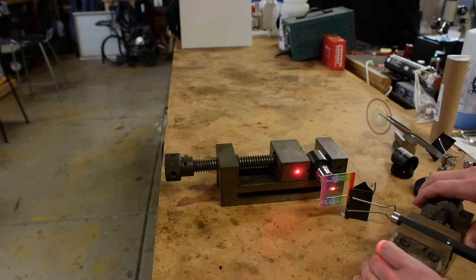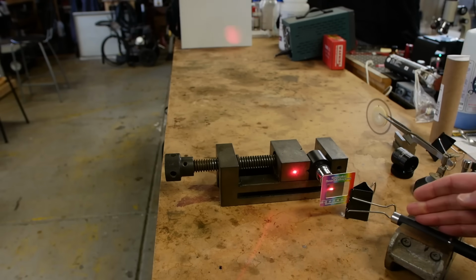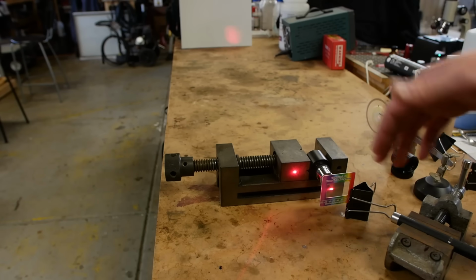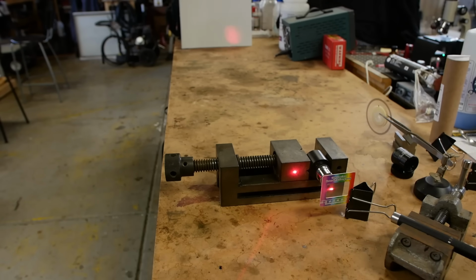Then when we get to the magic angle for 1,000 lines per millimeter, all the white squares will be activated and we'll see that. So the image that we're getting tells us where in the image that spatial frequency is happening. It doesn't tell us exactly what spatial frequency it is, because we're getting that information from the angle.